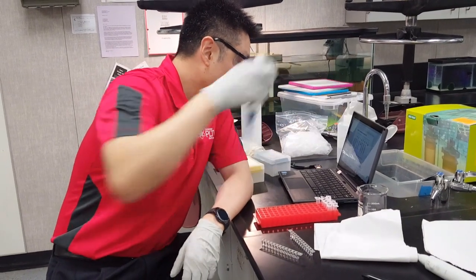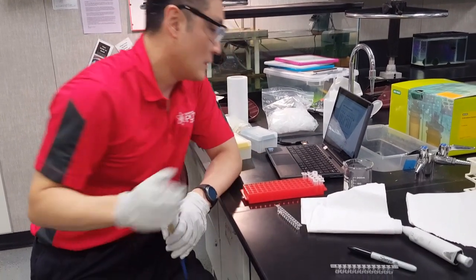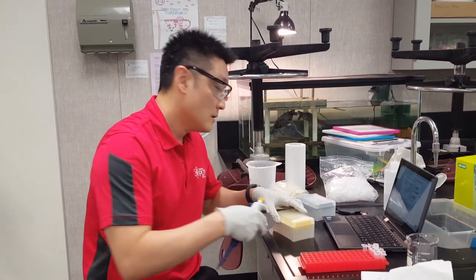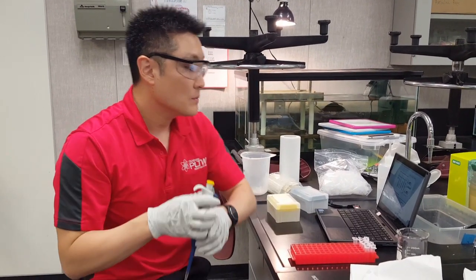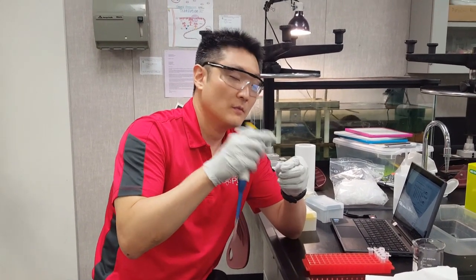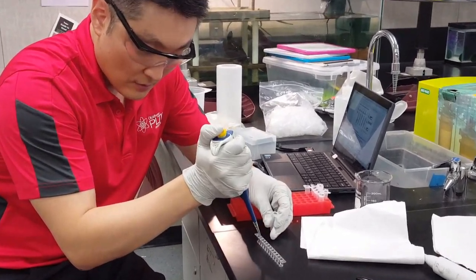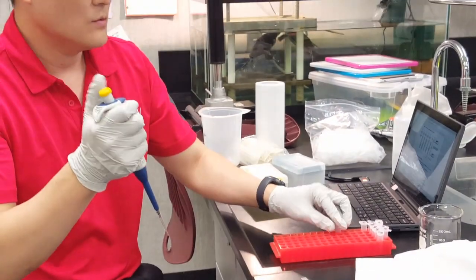Once the serial dilution is done, put strips 1 through 12 to the side. Get the second set of strips, 13 through 24. Add a new tip, get the positive control, and add 50 microliters of positive control into wells 13, 14, and 15. Then change the tip.